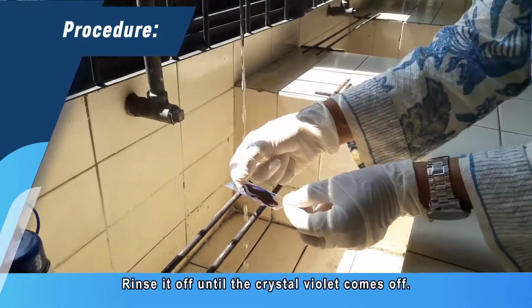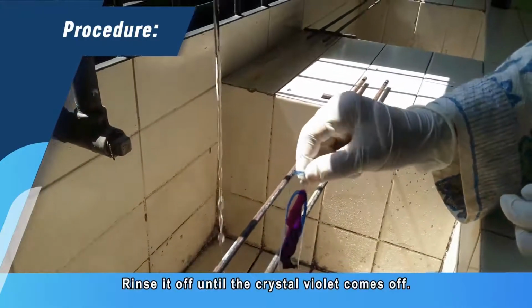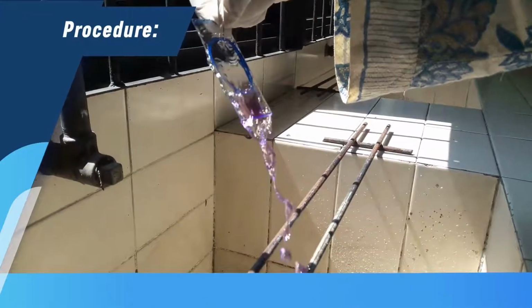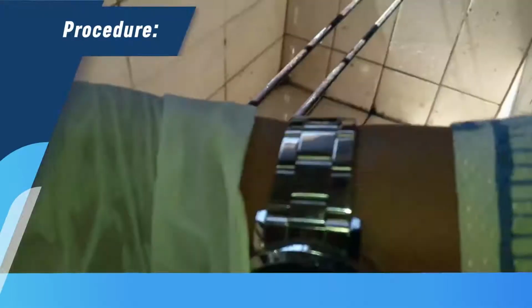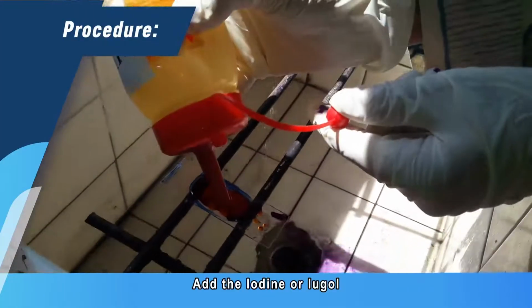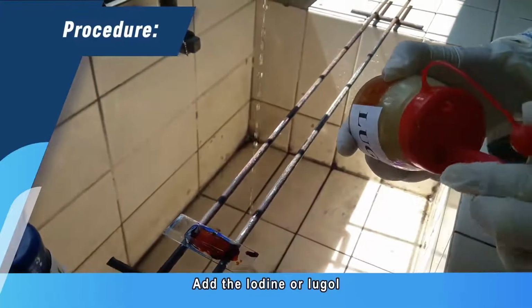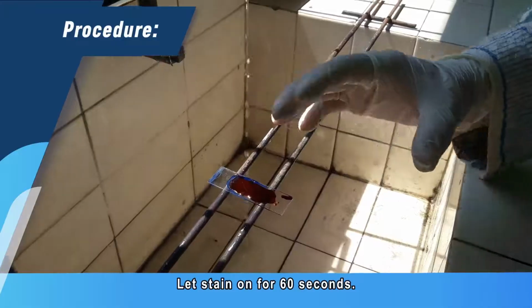After the 30 seconds with the crystal violet, dump the crystal violet in the sink and rinse the slide until the crystal violet comes off. Don't over-rinse, and shake off the excess water. Now add the iodine or Lugol's. This fixes the crystal violet in the cells. Let the stain sit for 60 seconds.